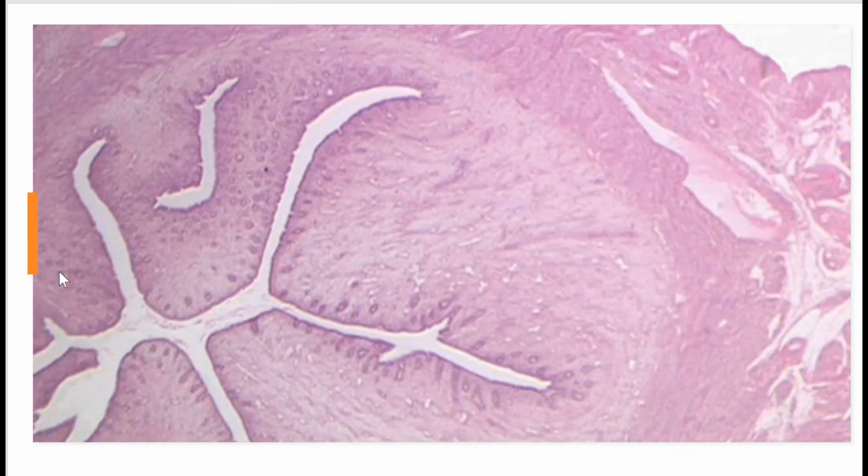Okay, what's this one? I don't know. You tell me. I would say this one's hard to see, but I would say it is proliferative because I can see the ones here that are a little bit straighter. It looks like it's got some straightness going on, so I'll say this is proliferative.